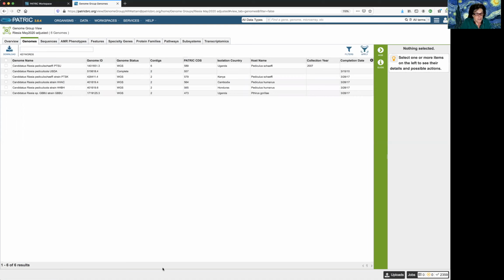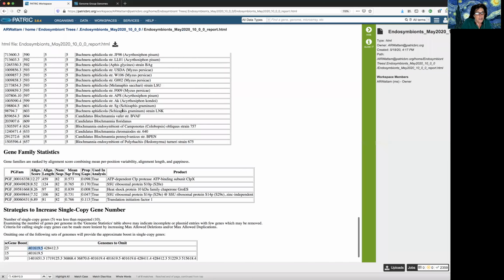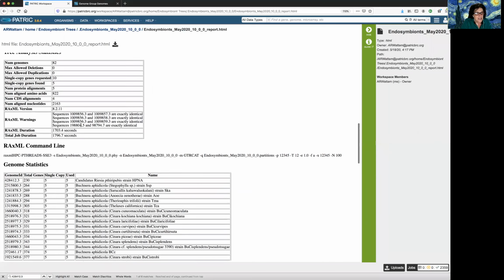Another thing you may want to do is get rid of some of those genomes that were identical. Especially when you're looking at a really big tree, it's one thing if it's your own private genome that's identical and you want to include that in the tree. You don't want to get rid of that one. But in this public one, we had a lot of genomes there. If we have some extra baggage that we can get rid of, let's do it. So let's go back here and let's scroll up a bit. And let's look at the identical genomes.